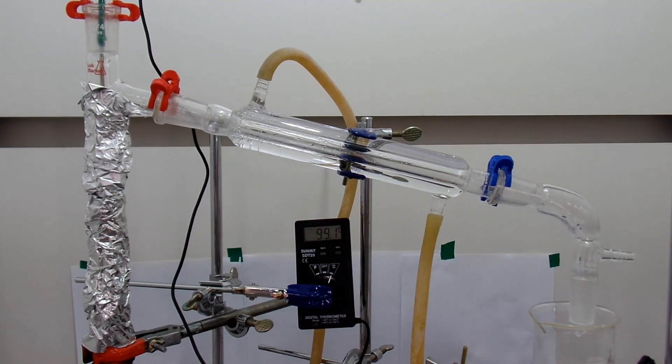So you should do the distillation after you dry the benzyl alcohol using magnesium sulfate, but you will need quite a lot of magnesium sulfate to dry a half water and half benzyl alcohol mixture. And you will inevitably lose some benzyl alcohol because of the azeotrope.